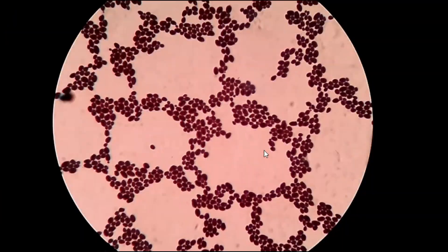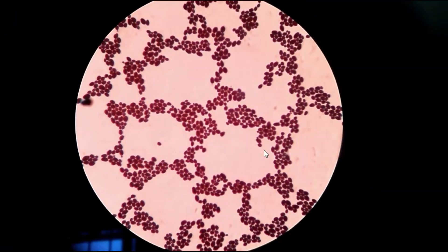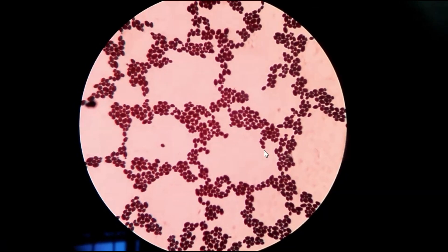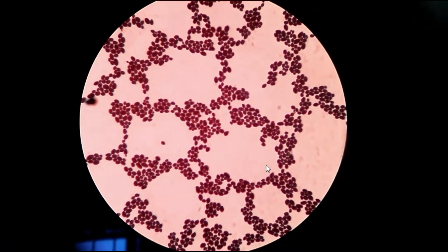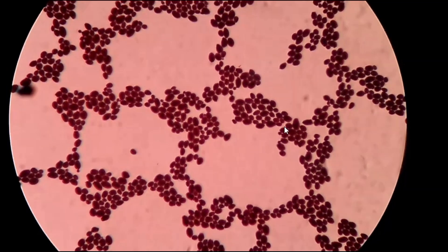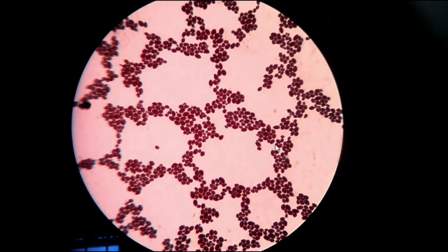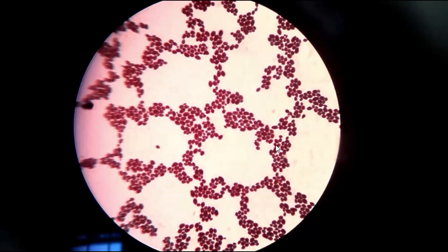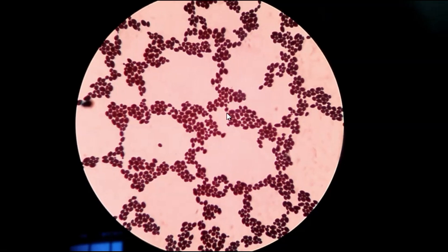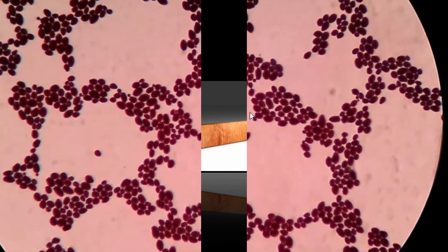In this way you are able to observe a standard slide of gram-stained Candida species. I hope this clip will be helpful.